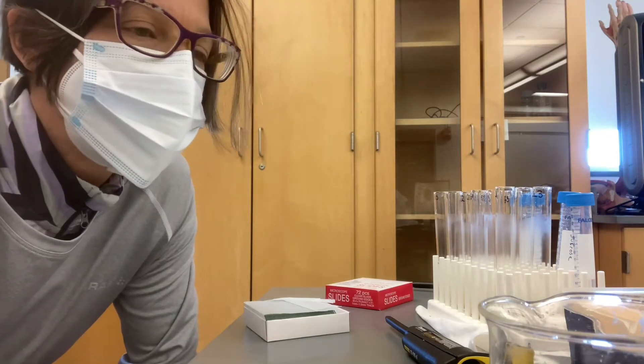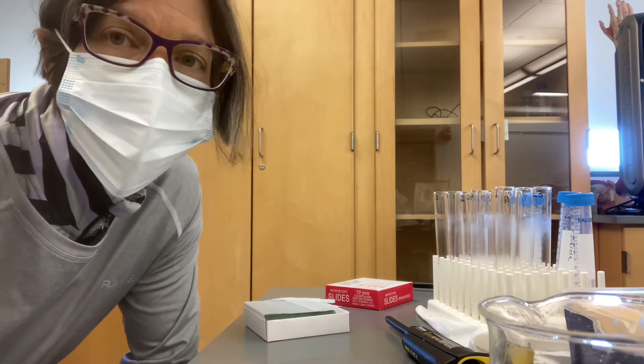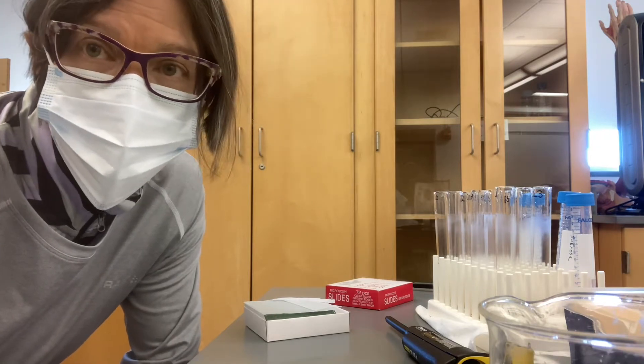All right guys, I'm going to show you how to set up the slide, the wet mount, stained with methylene blue in order to do the yeast viability assay.